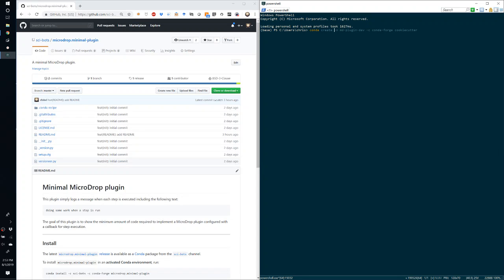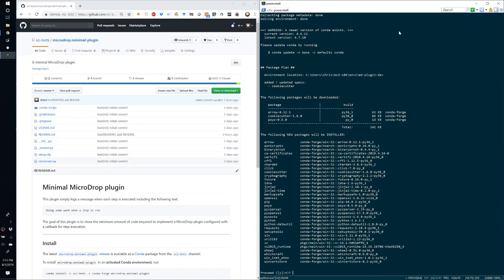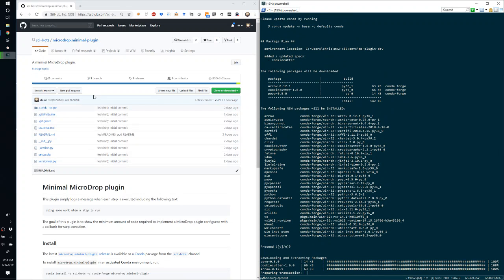-n means the name of the environment. So in this case, I'll call it MD for Microdrop plugin dev. And then we have to specify explicitly that we're going to include the conda-forge channel to install the package called cookiecutter. And what cookiecutter is, is a Python package for performing code generation using Jinja templates. So as you can see, it's going to download some dependencies and create that environment for us.